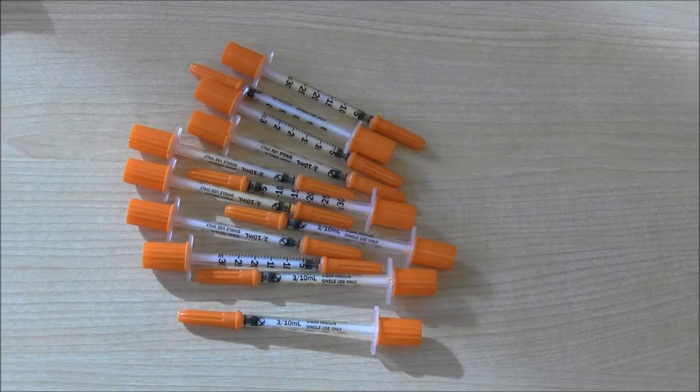Obviously, I'm using these needles to mark terrestrial salamanders, so the amount of elastomer you'd load into a syringe, or the amount you might make in a single session, will change depending on what specimens you're trying to mark.